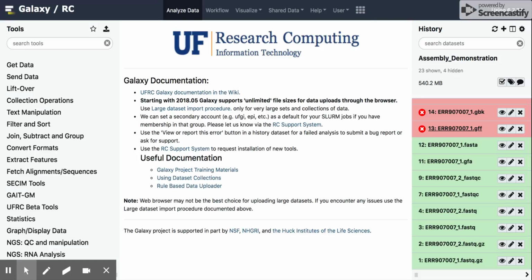We left off the last video running a workflow that was already established and saved in our workflow browser. This was performed on a pair of FastQ.GZ reads, which were from Illumina paired-end sequencing of a bacterial isolate of Streptococcus pneumoniae. And here we have the results of that analysis.